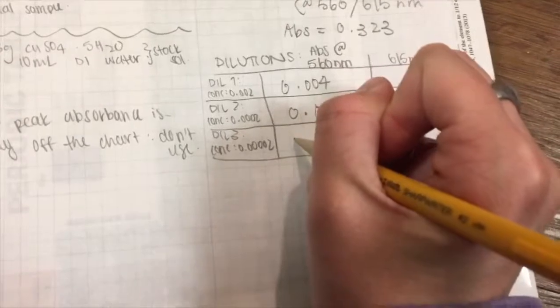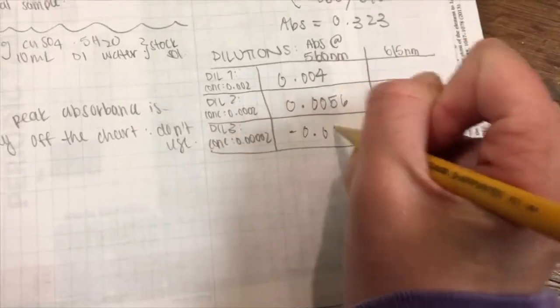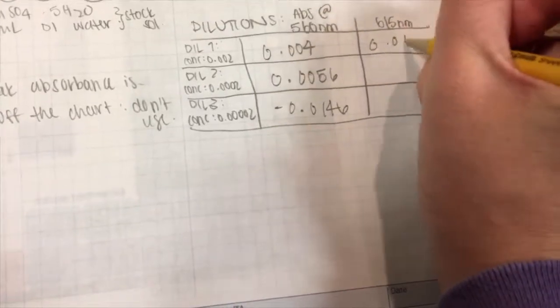Lambda max refers to the wavelength in the absorption spectrum where the absorbance is maximum. It acts as a single quantitative parameter to compare the absorption range of different molecules. Another reason we are scanning across all wavelengths is because we are using different concentrations of dilutions and unsure of what wavelength is the most accurate.